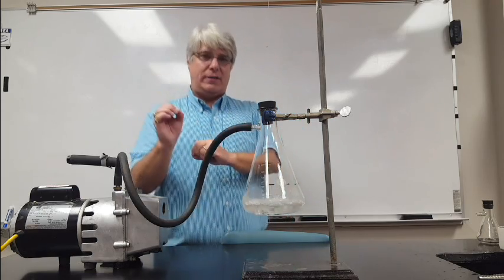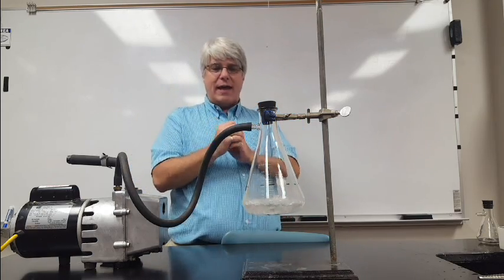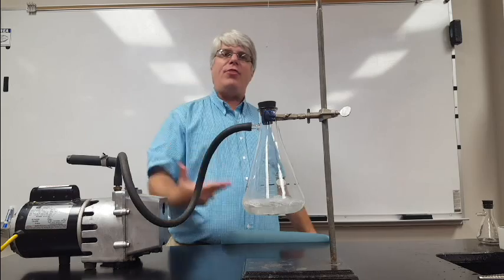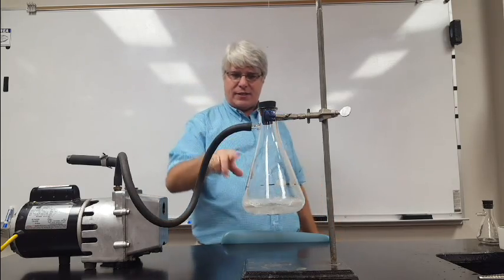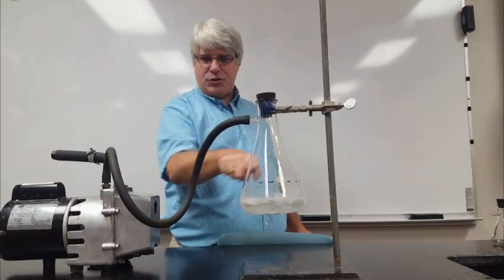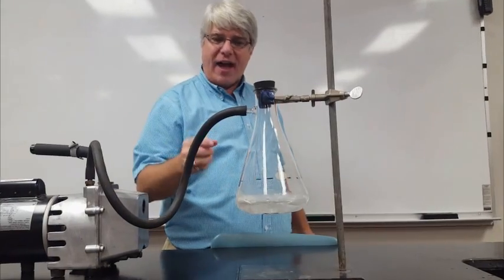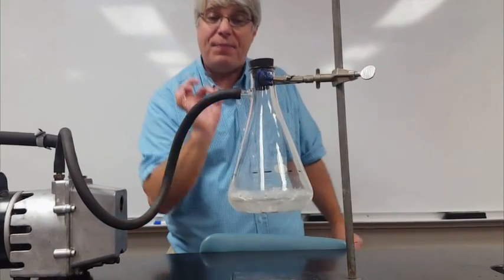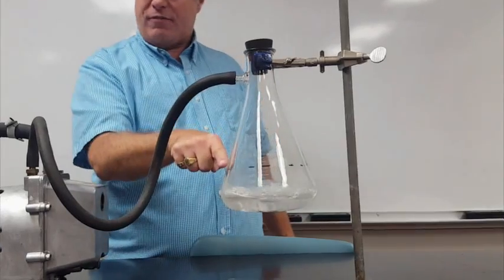This is called the triple point of cyclohexane because we're at a point where all three phases exist simultaneously. I've got the solid phase—you see the solid forming there. I've got the liquid phase—you can still see it bubbling—and I've got the gas phase, the bubbles that are forming.